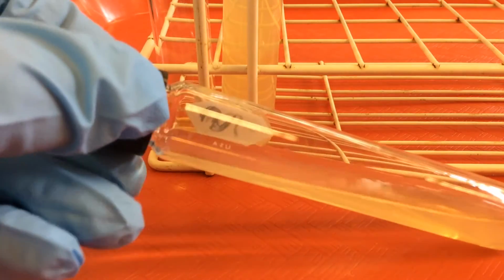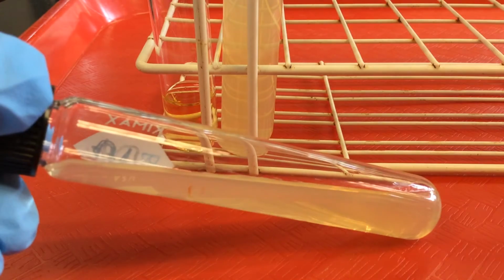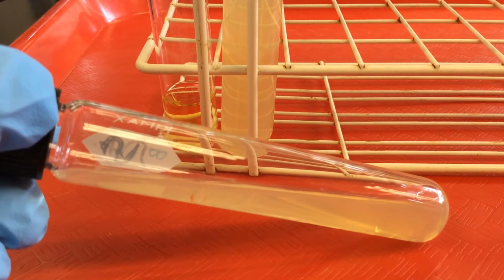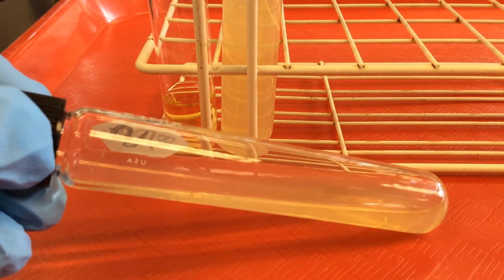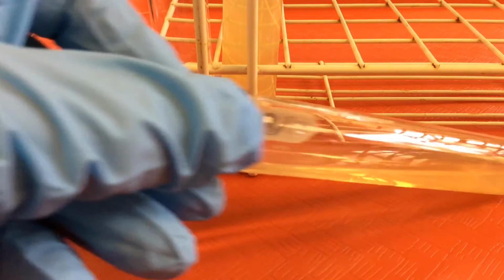If, when we autoclave our tubes containing our agar, we let the tubes solidify at an angle, we can see we get this nice ramp or slant of agar. This increases the surface area upon which we can transfer our microbes to see if they can grow aerobically, with air. And again, you guys want to remember to barely loosen those screw caps if we inoculate them with our microbes.